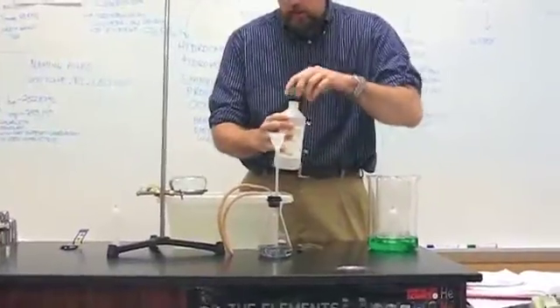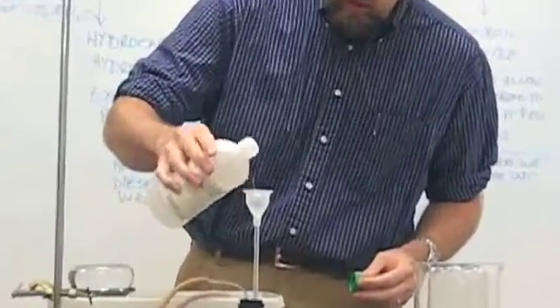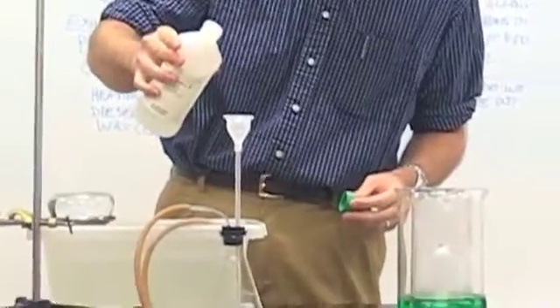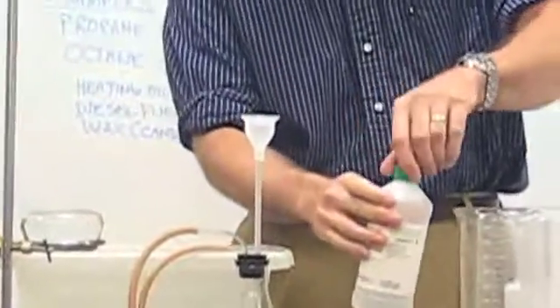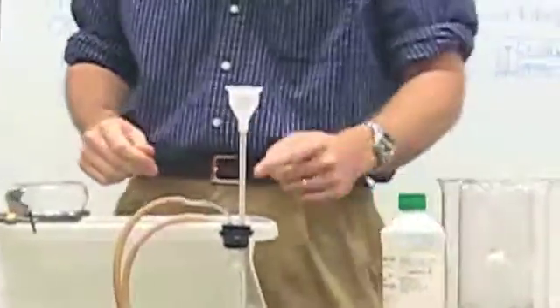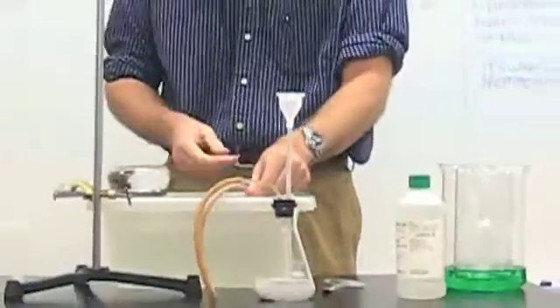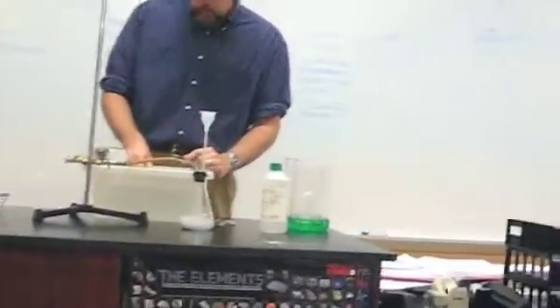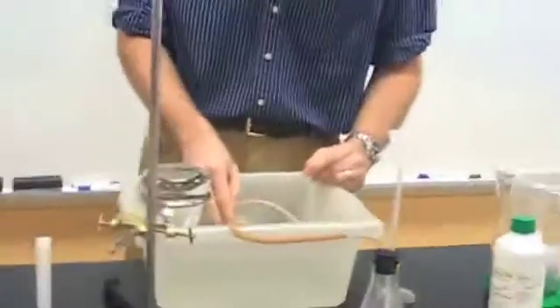So we're going to make sure there's no air in there, and I'm going to use this one here, actually. And the way we do this is just add a little hydrochloric acid to the apparatus. There's some water in the bottom of this flask so that we can make sure that this only goes one way, it doesn't come spurting back up out of here. And actually, if the cameraman would come right over here, you can see the bubbles. I have to let the bubbles come out for about 30 seconds in order to flush the air out of the apparatus, because of course the apparatus is completely full of air. We want to have no air involved here.